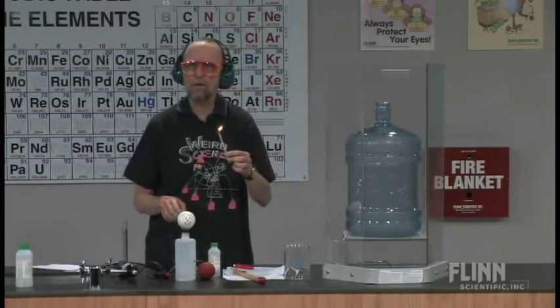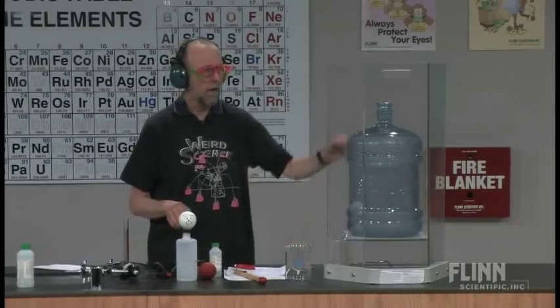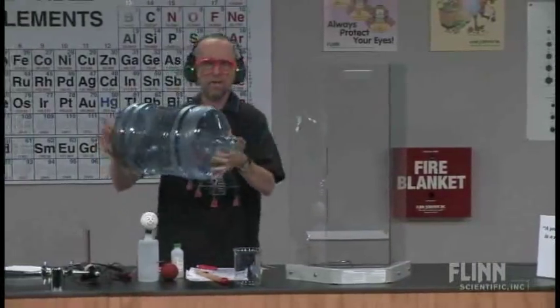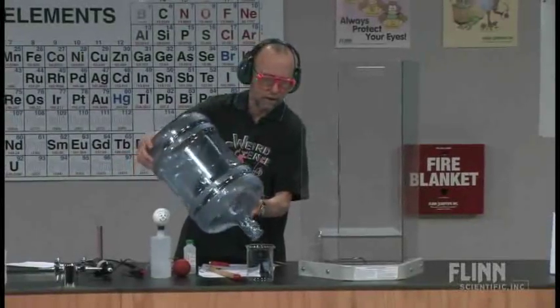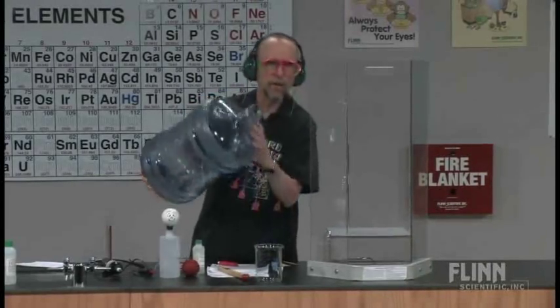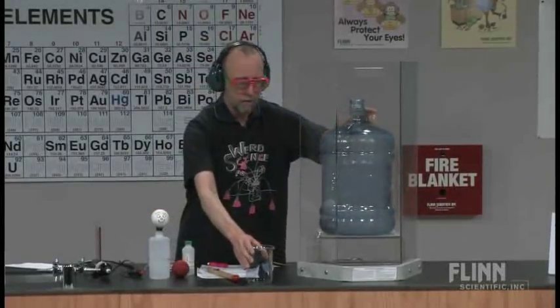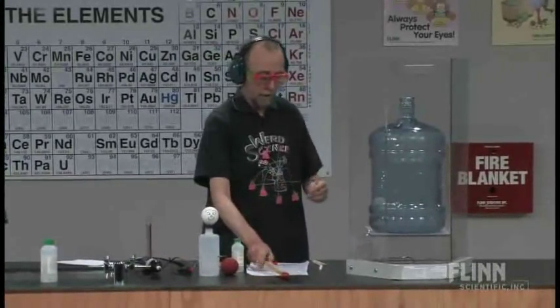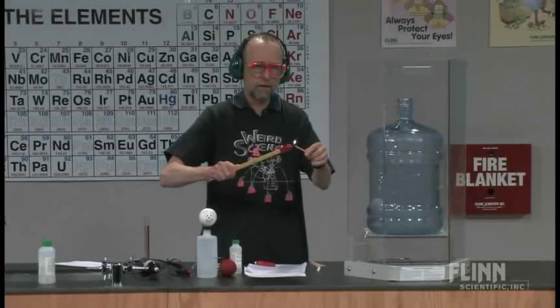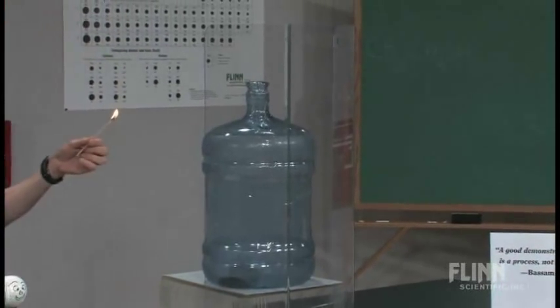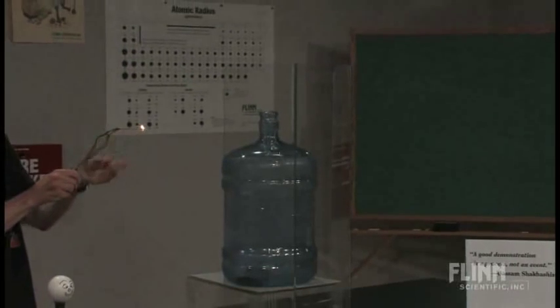Oh, you know, I forgot. I've got one thing. It turns out that the liquid itself is not that important. It's really the vapors that are important in this reaction you're about to see. So I'm going to pour the vapors, or the liquid out. While the vapors, the ethanol vapors, are the important part. So there, I've poured out the fluid. I'm going to move that away. And, why, look. Here I've got my wood splint again. And now we're going to get the lights down. And I'm going to hold it with the tongs. And I think you'll see why in a moment. Don't forget to cup your ears now. So here we go. We're going to just drop this in.